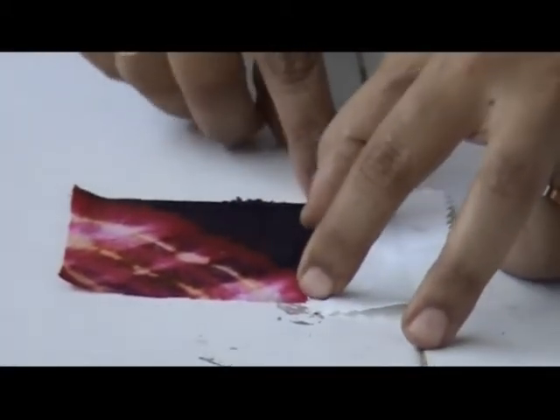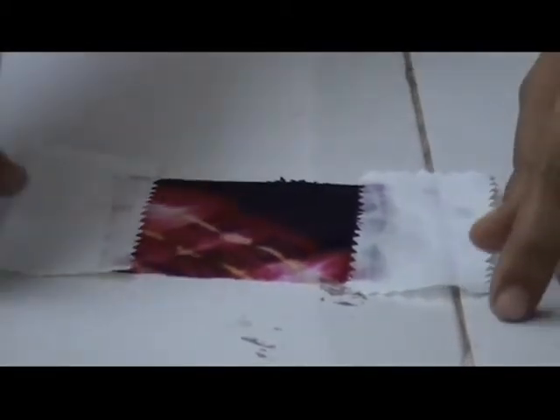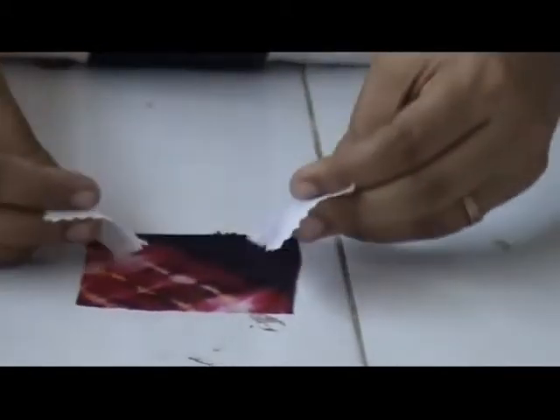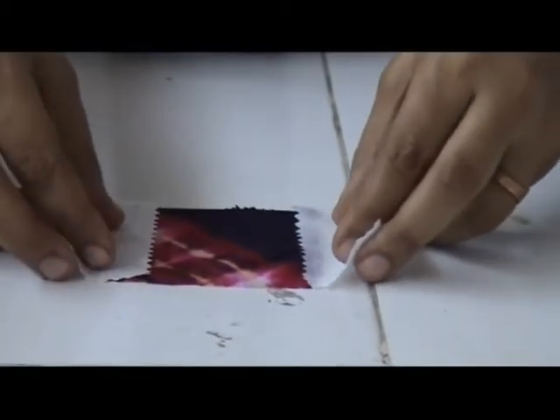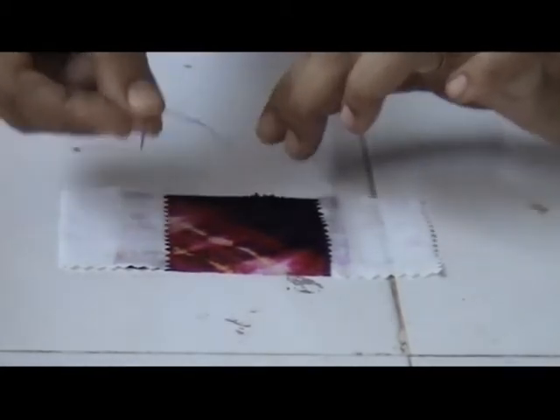In the case of yarn, a white yarn is entwined to make a composite sample. Whereas in the case of fiber, it is composed in the form of a sheet of 10 cm by 4 cm and held in place by sewing it in between pieces of cloth measuring 10 cm by 4 cm.